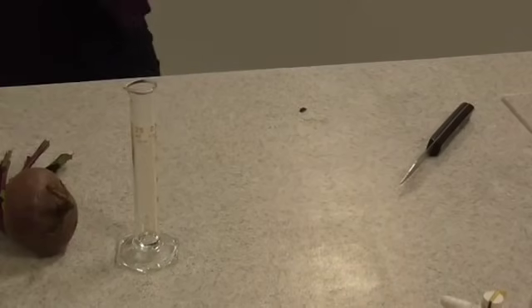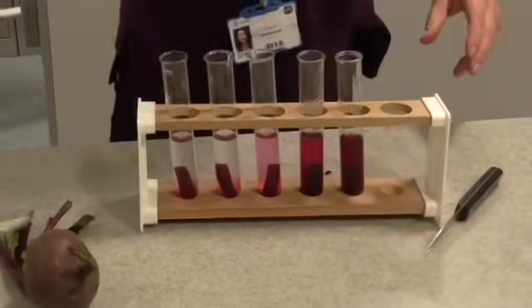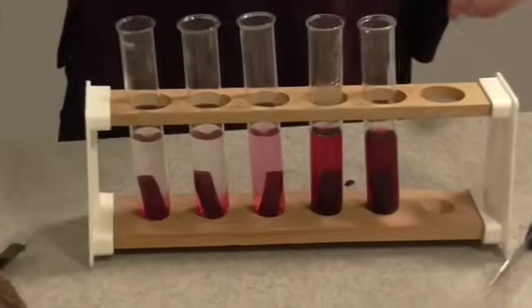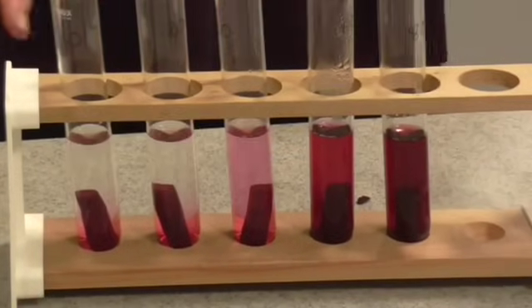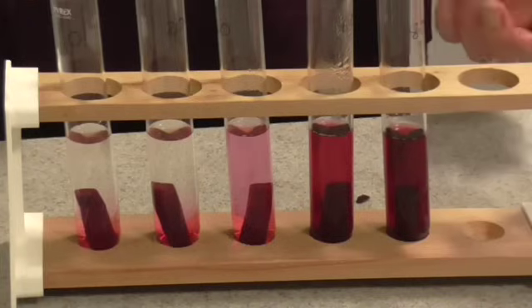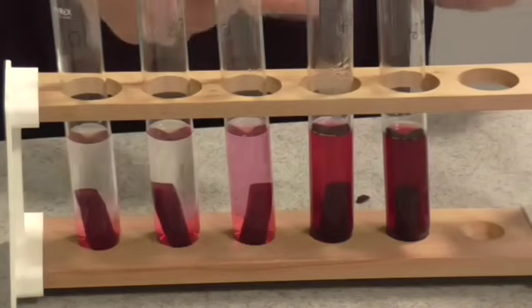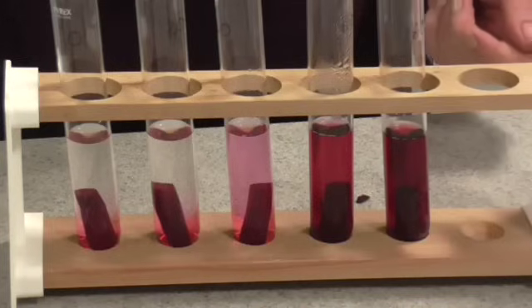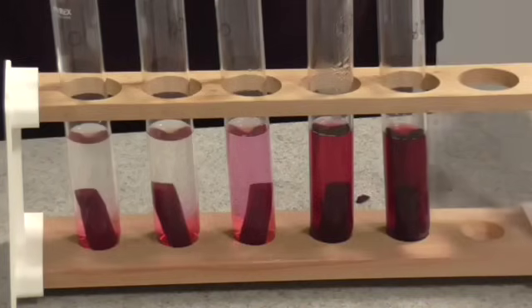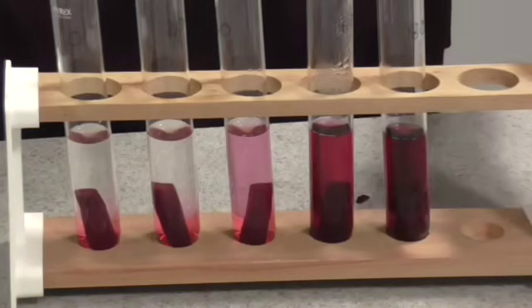After 20 minutes, when you remove your water from the water bath, you'll find that they look quite different. We can clearly see already that there seems to be some kind of correlation between temperature and the amount of anthocyanin that's leaked out of the beetroot. But we now need to make that a little bit more quantitative, so for this we're going to use our colorimeter.